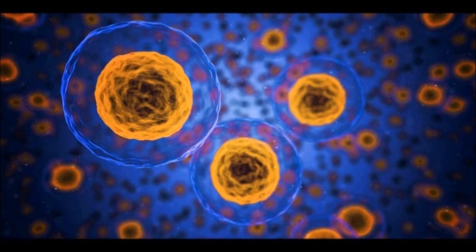To my delight, I was able to see visible droplets of what I would later determine were fatty acids. There was also a sheen on the surface of the liquid, and a rainbow effect, much like what you would see in a puddle of water which has been contaminated by oil. I was not able to capture this effect on camera, though, only witness it in person.